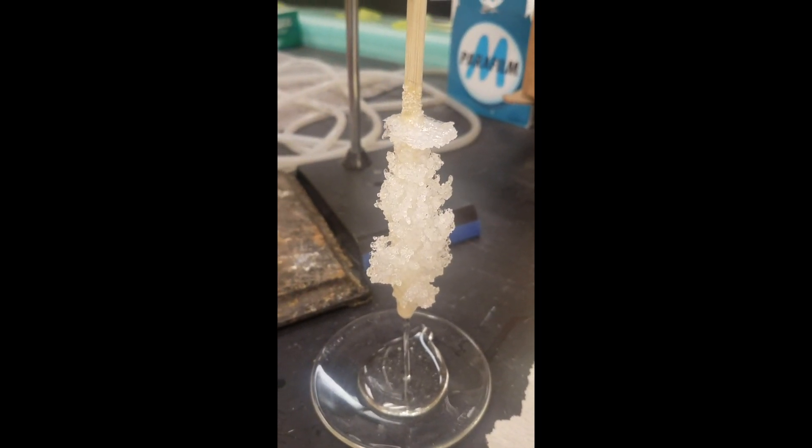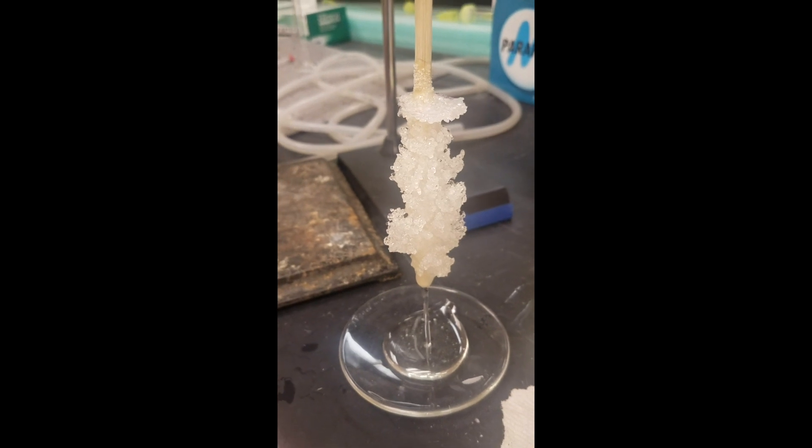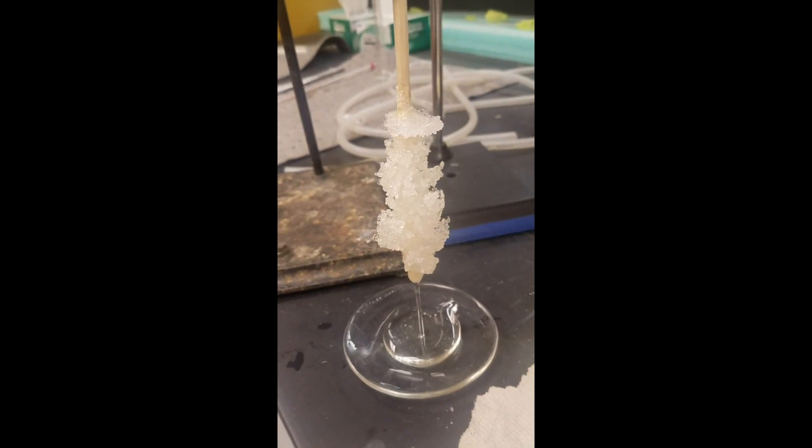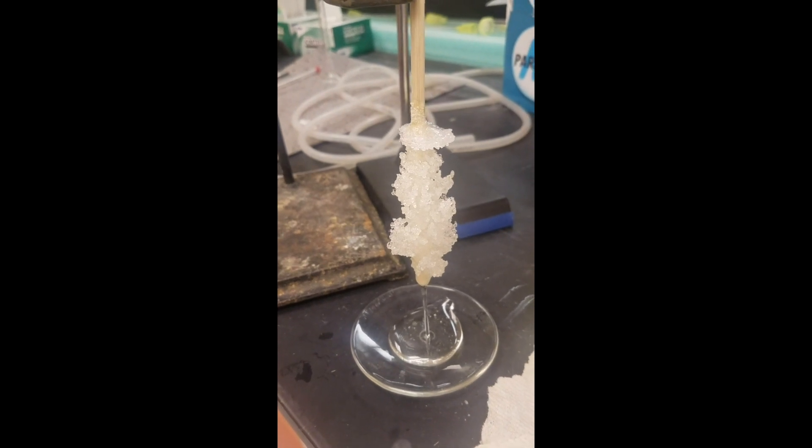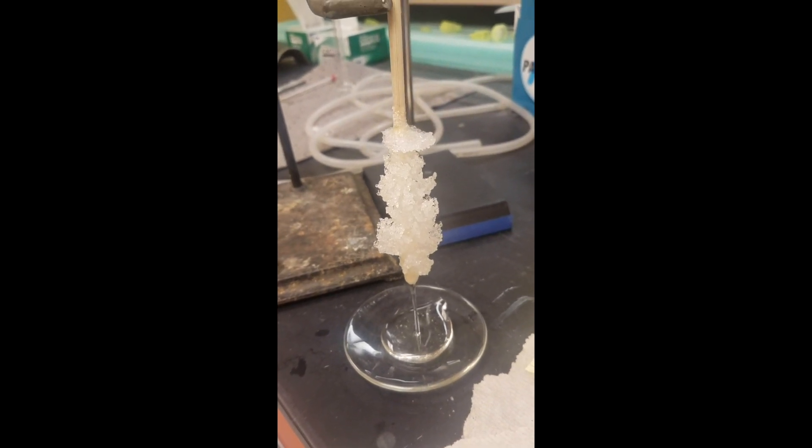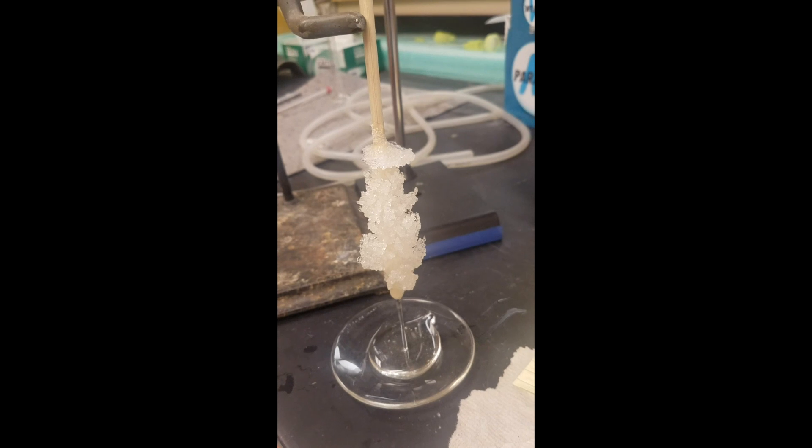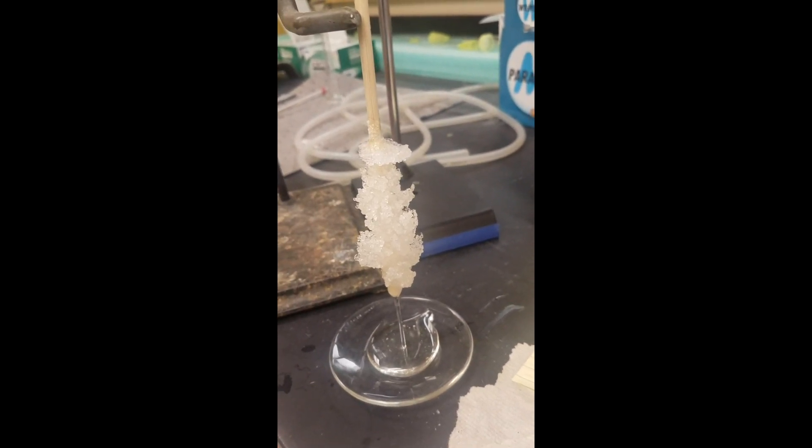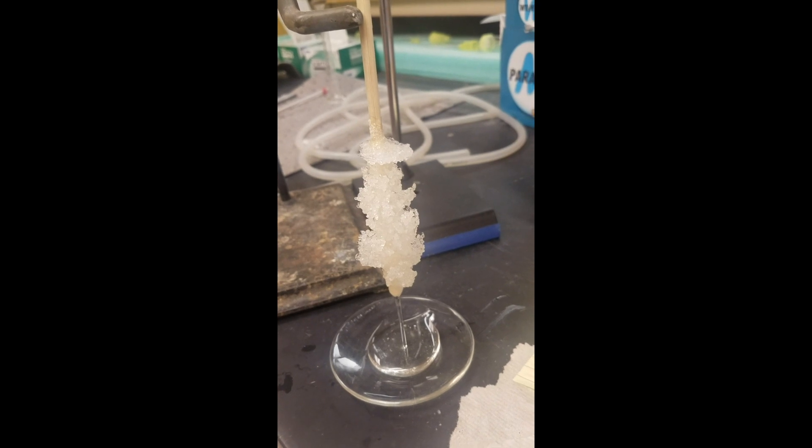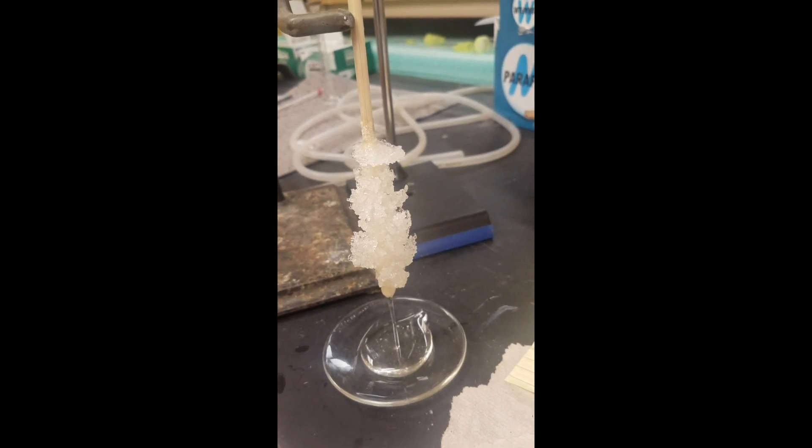After removing the crystal from the mother liquor, this is how it looks. Right now I am draining the mother liquor from the crystal using gravity. And what we'll do after this step is crush up the crystals and get a mass. And from this mass, we will use that mass to calculate the efficiency of how much we were able to crystallize. We hope you enjoyed our crystallization experiment. We hope to see you again soon. Thank you.